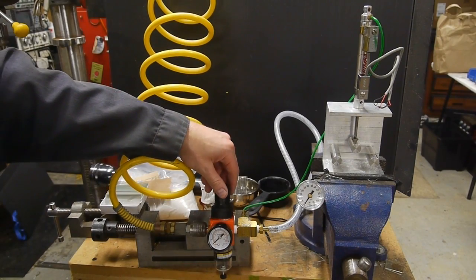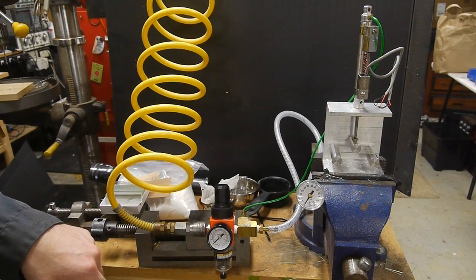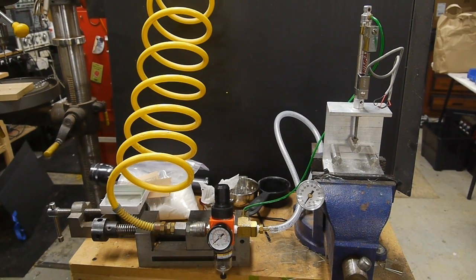I can control the pressure very carefully by dialing up the regulator here and the gauge here and here will show the pressure in the system. Alright so let's give it a go.